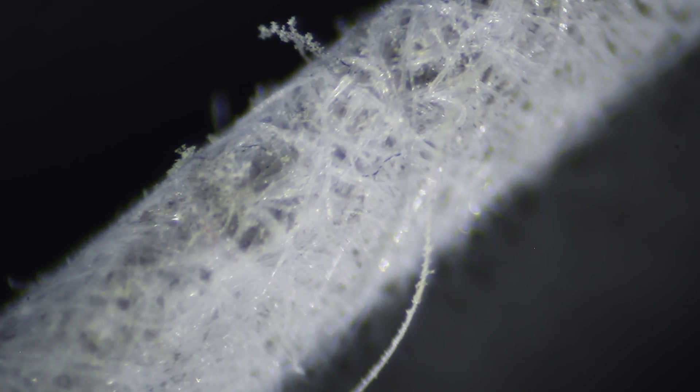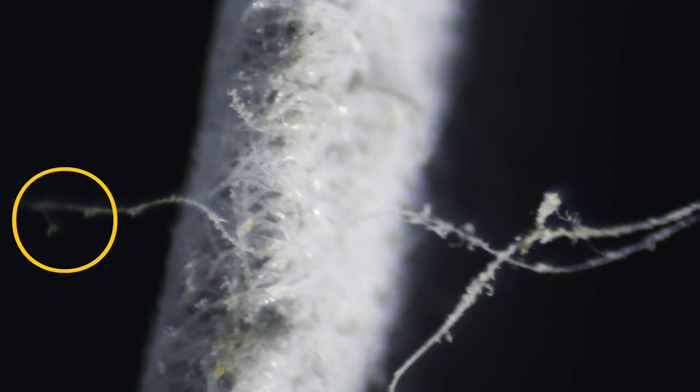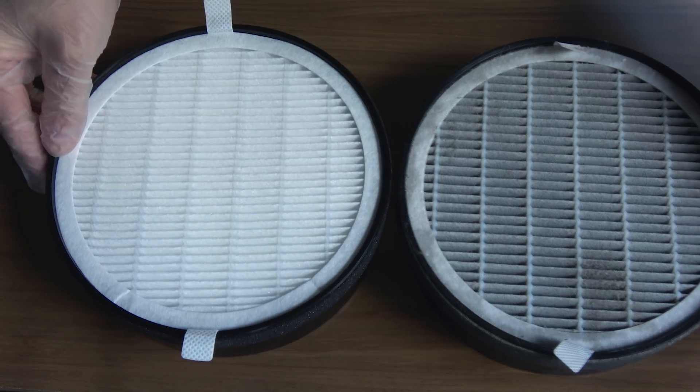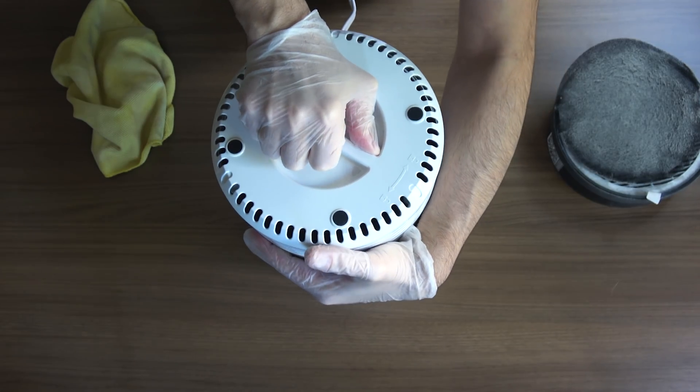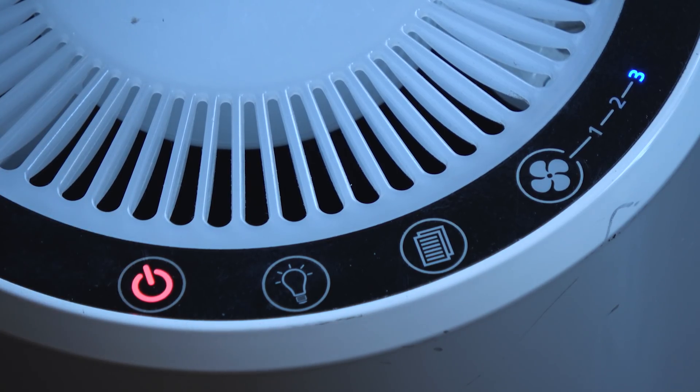This is precisely where true HEPA filters shine: a slightly dirtier true HEPA filter works better than a brand new one. As you can see, bigger dust particles become another layer and trap finer dust. This filter is filled with dust but still doing its job very well. Check out the dust speck on the corner — the HEPA filter can still pass air even though it is dirty and outside of the air purifier. The new filter is on and it will be cleaning the air for the next six months, unless I forget to change it on time.